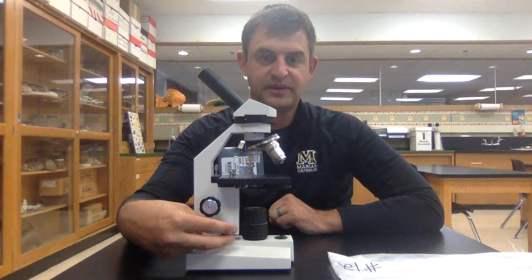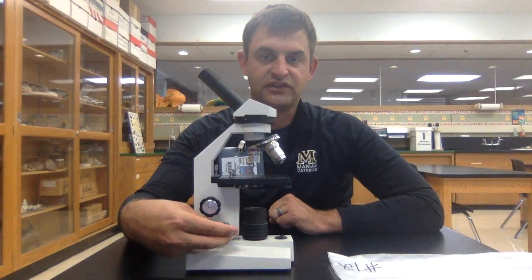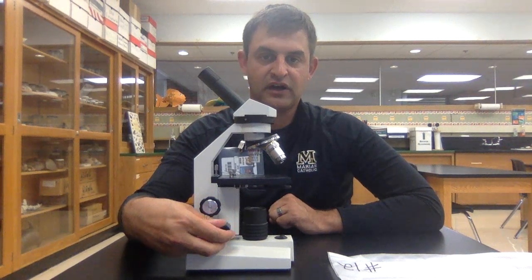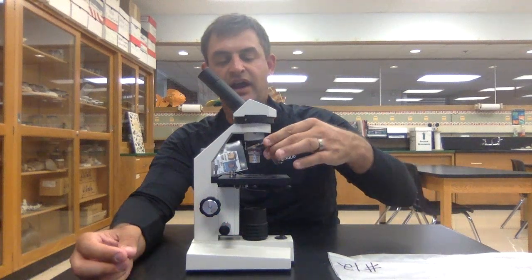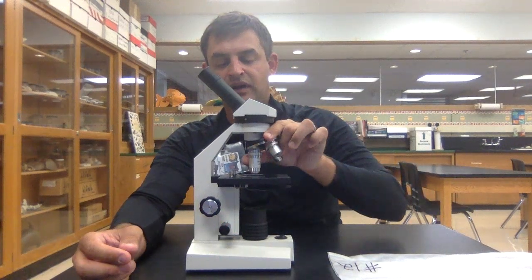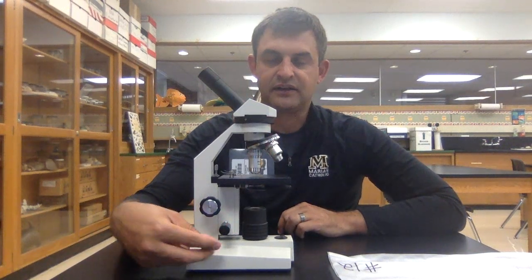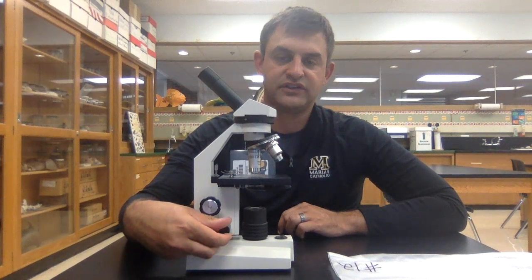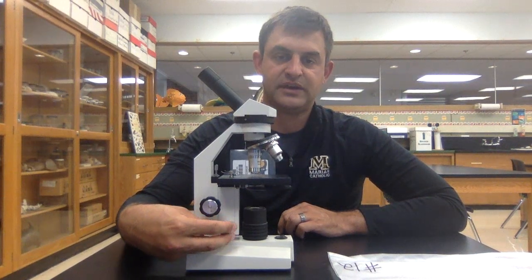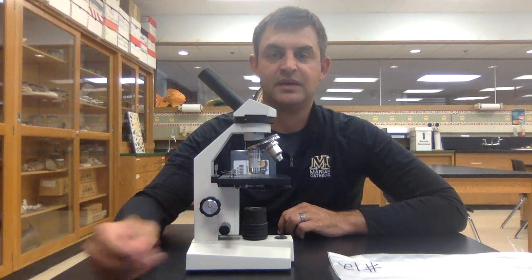This smaller knob is called the fine adjustment knob. You'll notice you don't see the stage moving hardly at all. So when you're on high power and the object is not clear, you would only use this fine adjustment knob to try to focus that image.